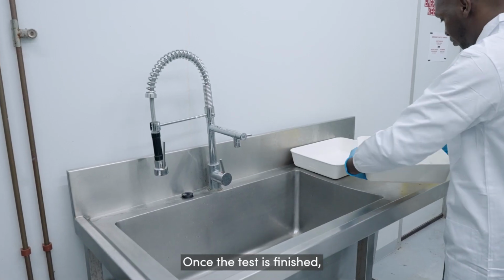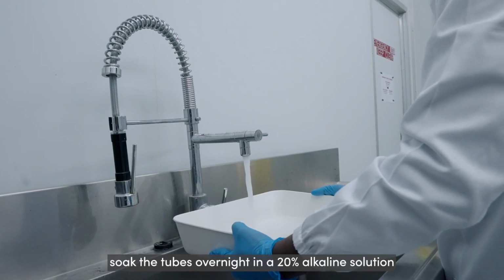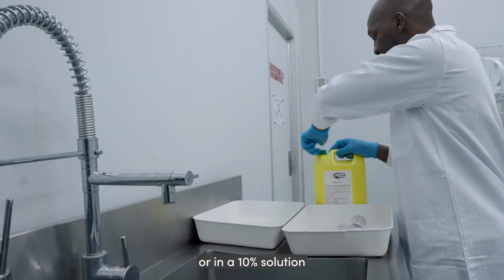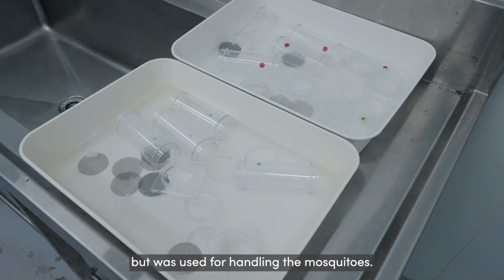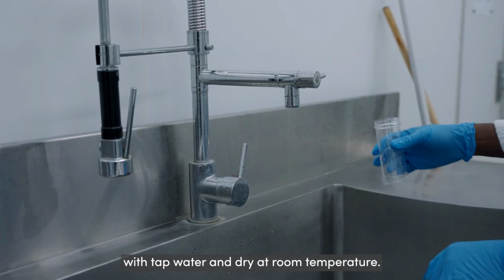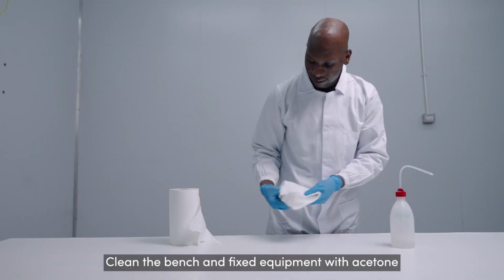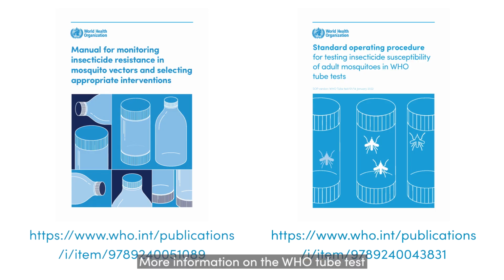Once the test is finished, soak the tubes overnight in a 20% alkaline solution for equipment in direct contact with the insecticide, or in a 10% solution for equipment that did not come into contact with the insecticide but was used for handling the mosquitoes. On the following day, rinse the equipment 3 times with tap water and dry at room temperature. Clean the bench and fixed equipment with acetone or 70% ethyl alcohol. More information on the WHO tube test can be found online.